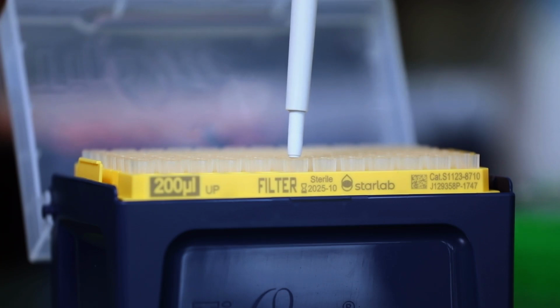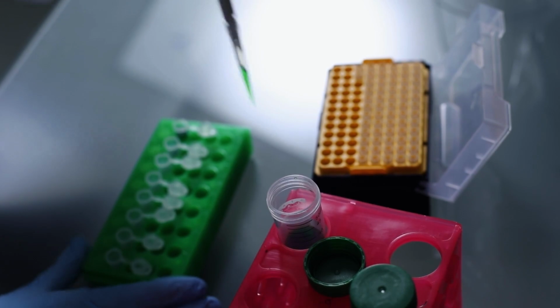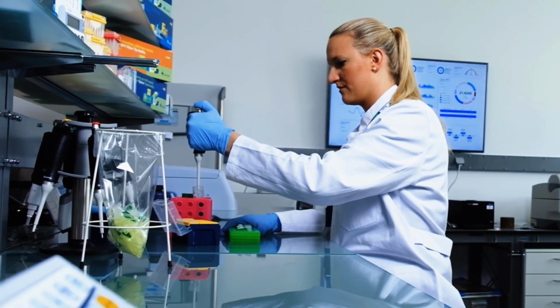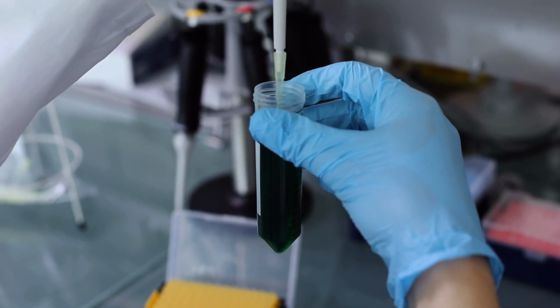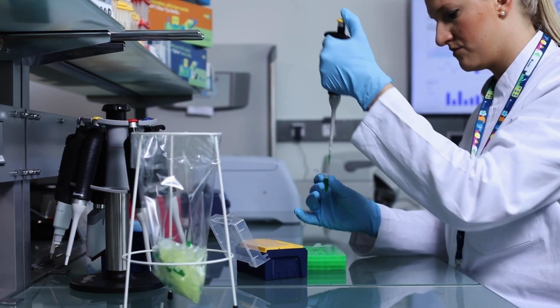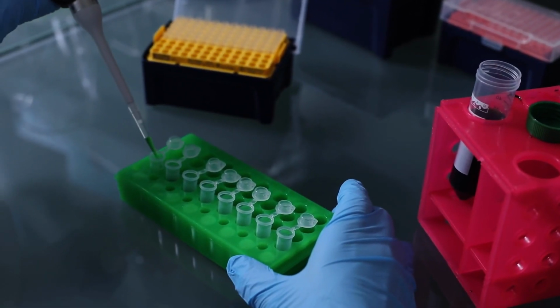Did you know the air volume in the pipette's tip cone can contract or expand depending on the temperature of the sample? If your sample is much colder than the tip, this can result in higher aspirated volumes. If your sample is much hotter than the tip, this can result in lower aspirated volumes. For the best results when pipetting, hold the pipette lightly in your hand and don't touch the tip cone. Even the warmth of your hands can increase the temperature of the air volume in the pipette, so not too hot and not too cold. Maintain a stable temperature. The closer the temperature of the pipette, the tip, and the sample are to each other, the better the accuracy.